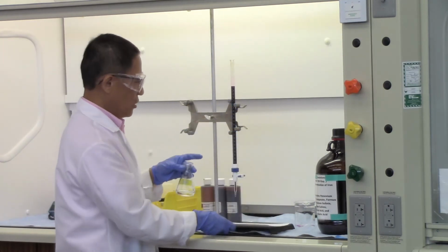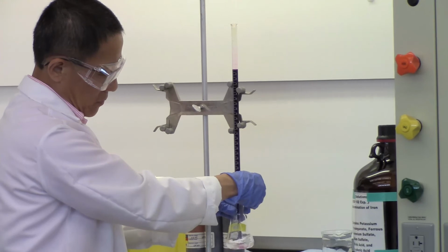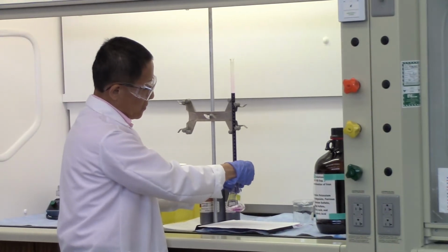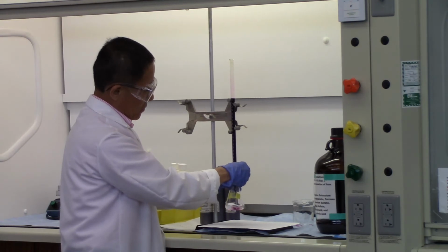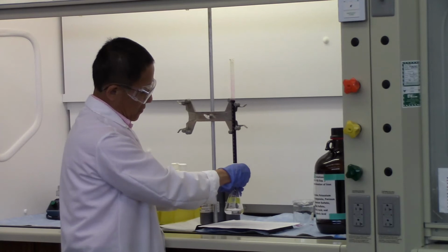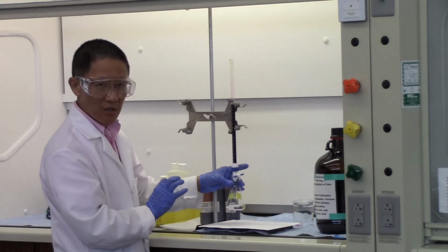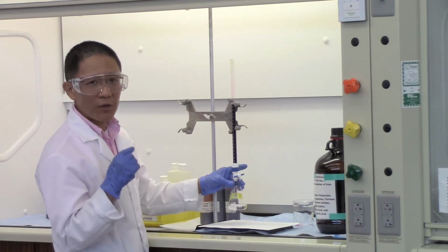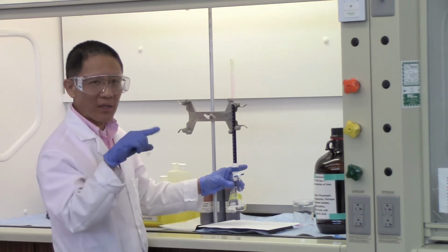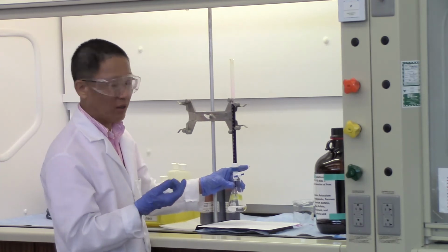Okay? So now it's clear. Okay? So that means we don't have enough KMnO4 yet. We just keep adding KMnO4. And you can see the disappearance of the pinkish color is getting slower. And once again, as I said, that's the time you really need more patience, not less. Okay? Sometimes you may need to add the titrant one drop at a time. What we are trying to get is that once you put that last drop in, you have a persistent pinkish color throughout the flask. And that tells you you have reached the end point of the titration.